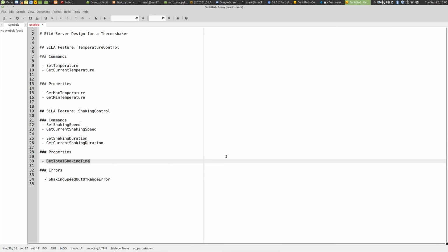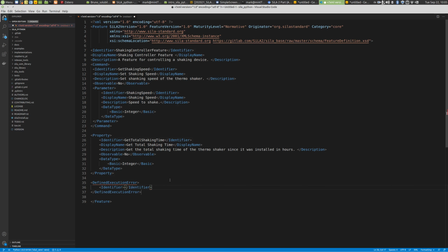And now finally let's just specify a defined execution error. Again, you have an identifier, and we want to have this shaking speed out of range error here. So shaking speed out of range error, display name, a nice display name, okay, and then description: shaking speed went out of range. Okay, so now we have specified a foreseeable execution error.